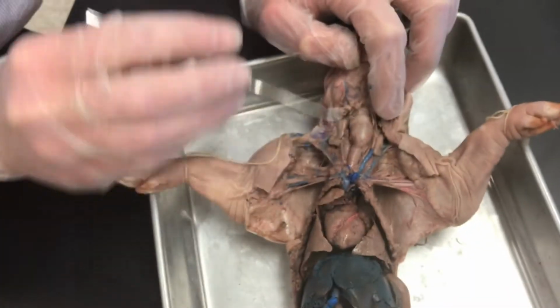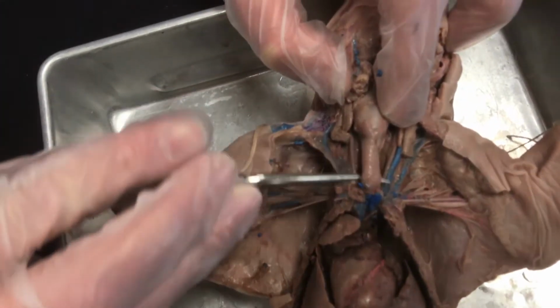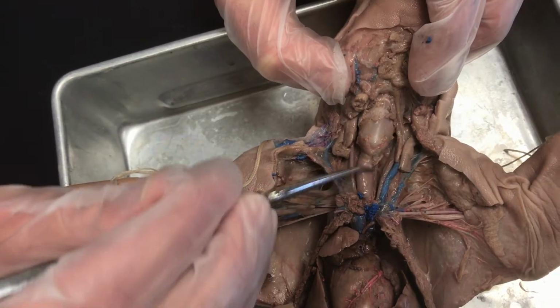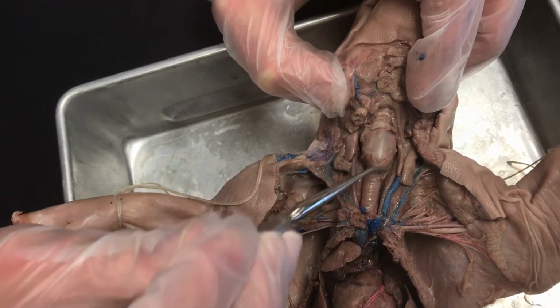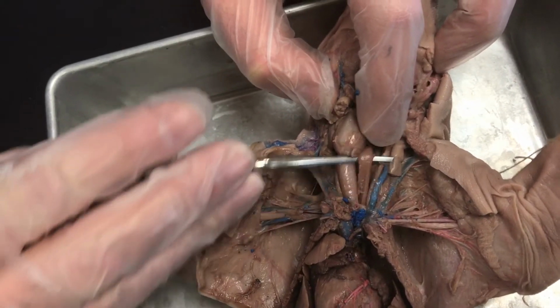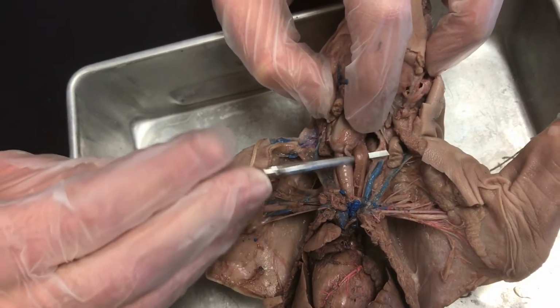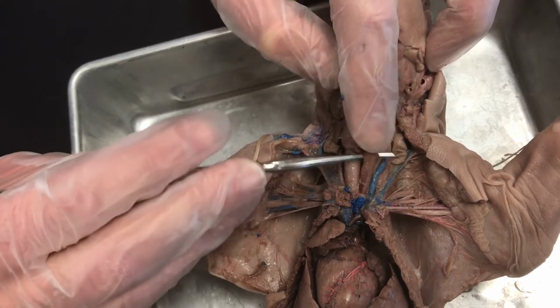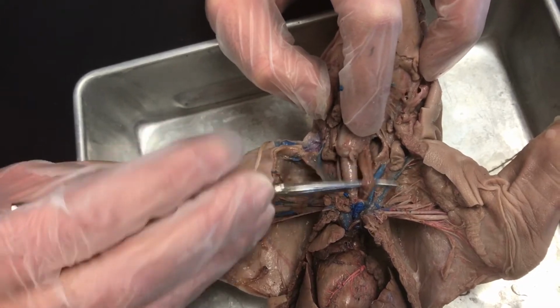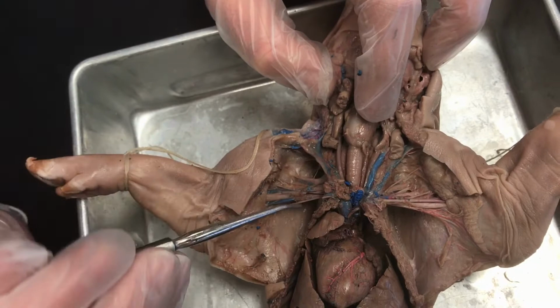If we lift that up, you can see this fairly rigid tube right here. This is the trachea. That's the airway for breathing. And then right above that trachea, the swollen region, is the larynx. Underneath the trachea, if we kind of push that out of the way, below that we see the esophagus. And the esophagus is a muscle that can squeeze food through. So the esophagus can be kind of flat like this because it's going to squeeze the food through using muscular activity, whereas the trachea needs to be wide open in order to allow air to go through.